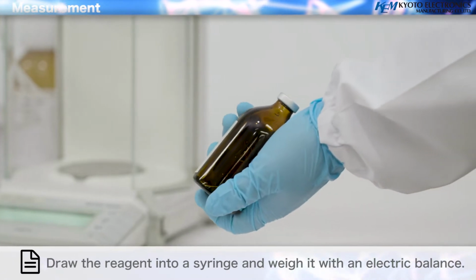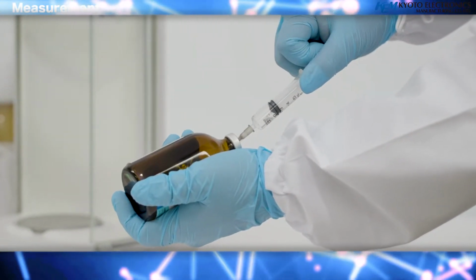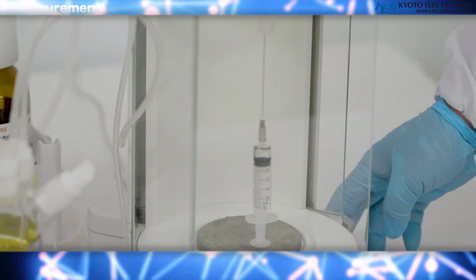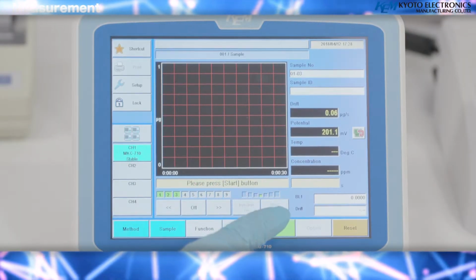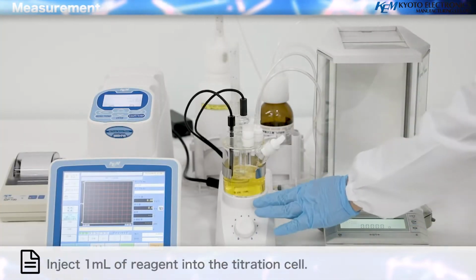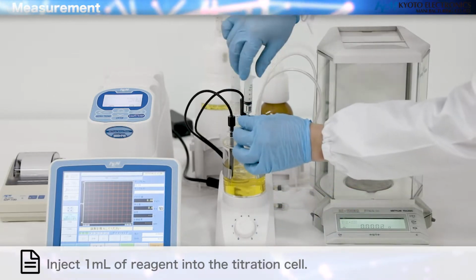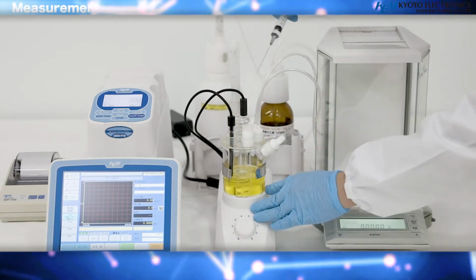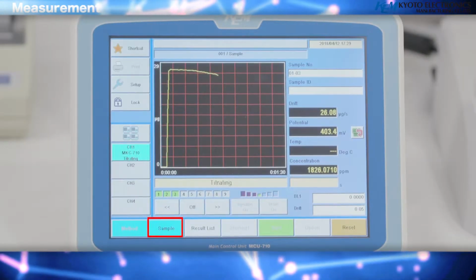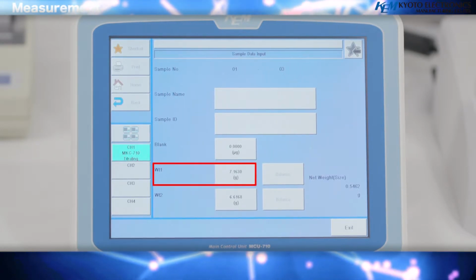Draw the reagent into a syringe and weigh it with an electric balance. Press the Start button. Inject 1 milliliter of reagent into the titration cell. Press the Sample button and Weight 1. Enter the total weight before the injection of the reagent.